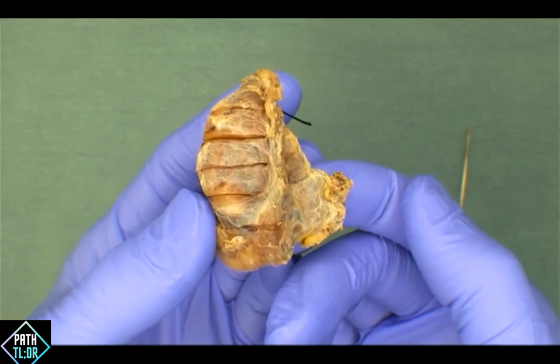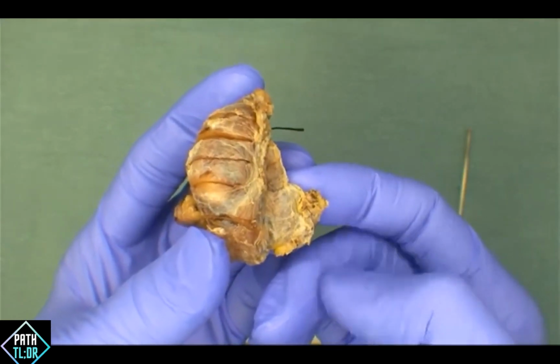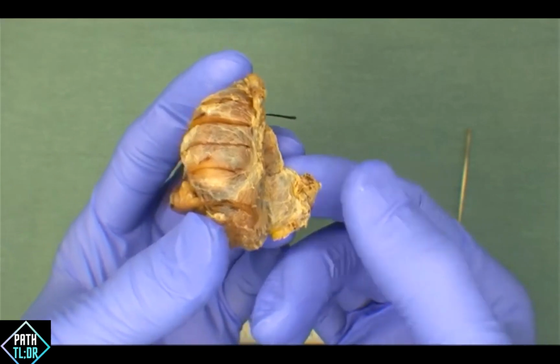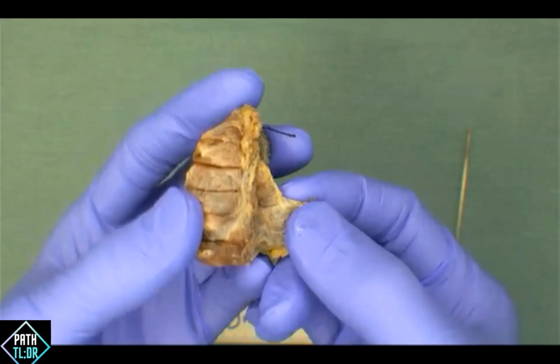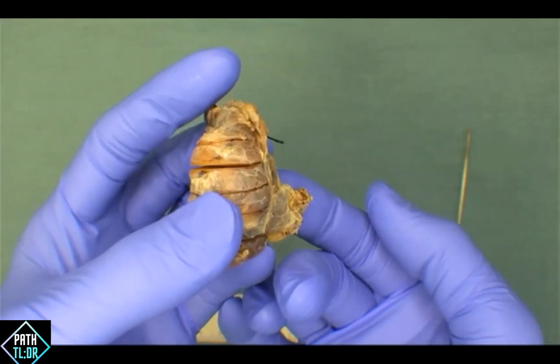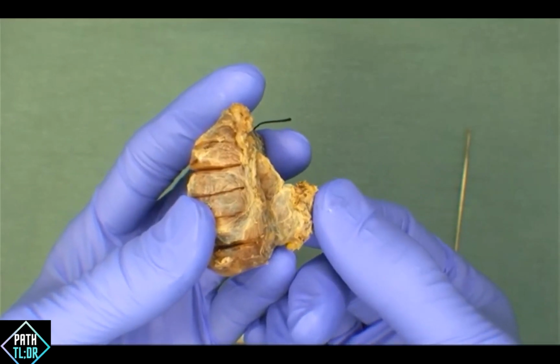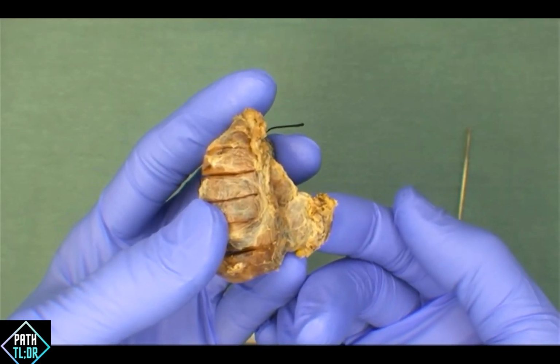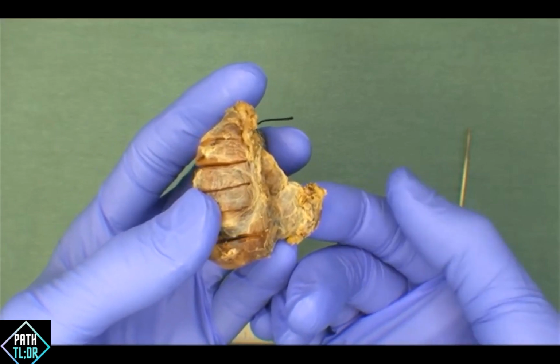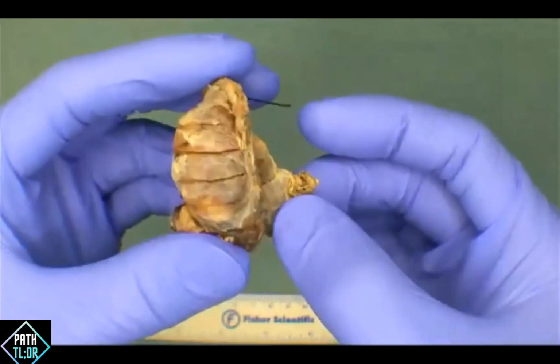From a surgical standpoint, a subtotal thyroidectomy is one lobe plus the isthmus and then a little bit of the contralateral side. And a hemithyroid, again, from a surgical standpoint, is one lobe plus the isthmus. I think we've got here a hemithyroidectomy, but I do recognize that we probably use both of these words rather interchangeably when it comes to just our practice day to day talking about these specimens. Okay. This is a hemithyroidectomy because we have one lobe plus the isthmus.